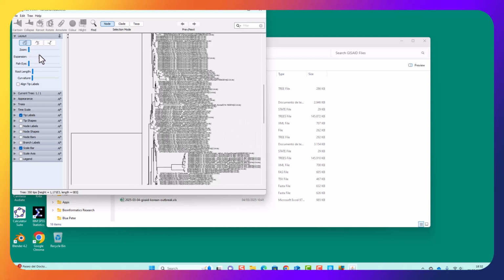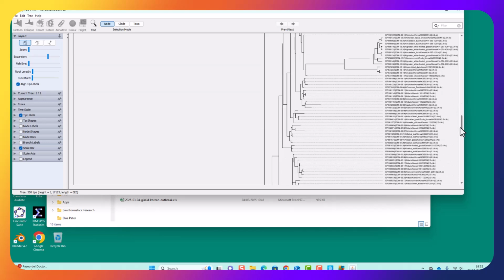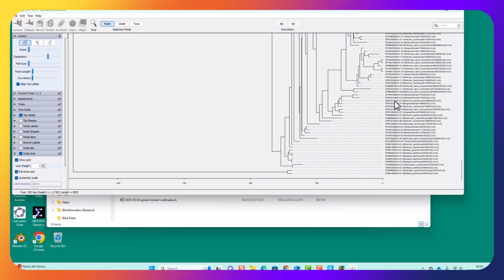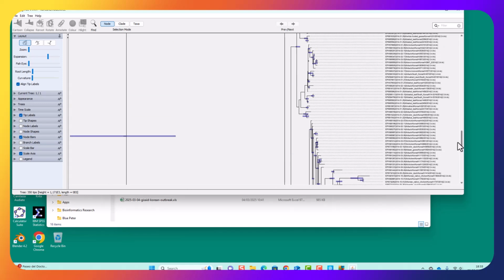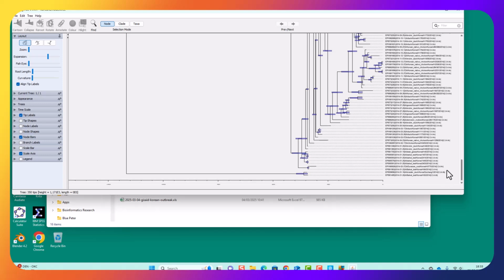Now I want to do a bit of expansion so I can see it properly and read all those bits of text. I prefer to make it a bit wider so I can see what's going on, and I'd prefer to align all of the tips so they can see the lengths of the different parts of the tree. Got that scale bar, which I don't like. I prefer to have a scale axis, and I want it to have a reverse axis, so 0, which is the most recent sequence, is there, and then it's minus how many days going backwards. I want to have node bars which describe the height, the 95% HPD. So that's a kind of confidence interval. It's the posterior distribution is its technical name, but it's like a confidence interval. So it is an unbiased estimate of the age, the height of that particular tree.